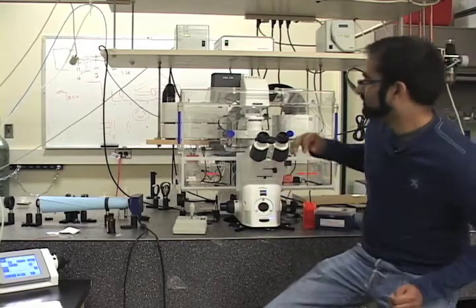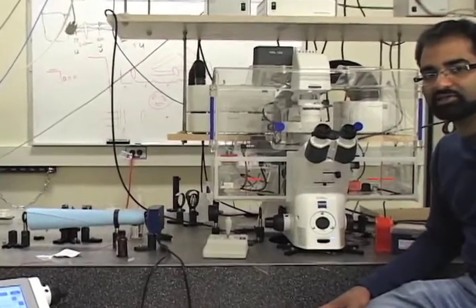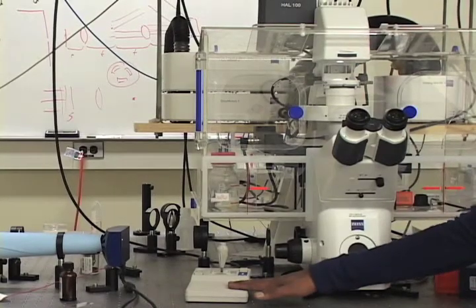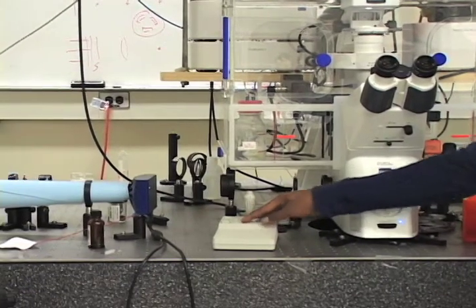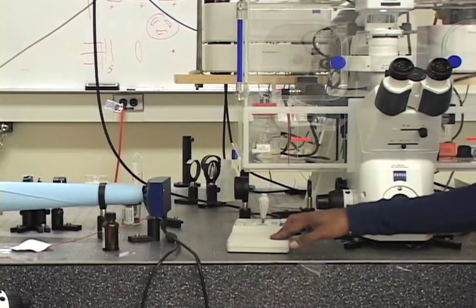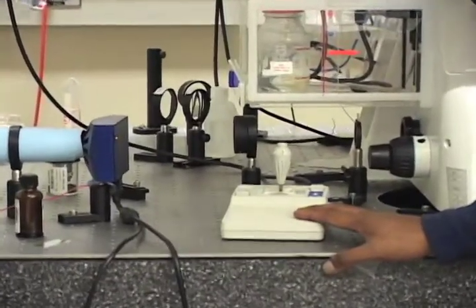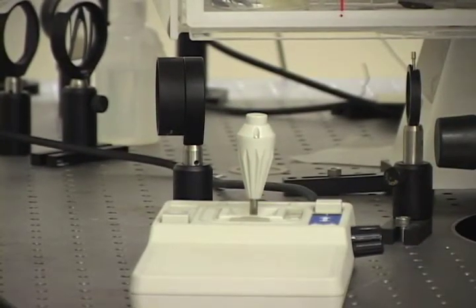Okay, so now that you have an idea what the SLIM setup looks like and how we operate the instrument, let me show you a few of the additional components on the scope that have enabled the live cell applications that you have heard about. One of the basic things that we really benefit from is having a motorized and programmable stage control. This allows us to scan over large areas, so we can acquire several high-resolution images of small fields of view, do a mosaic scan and stitch them together to get a large area at the end.